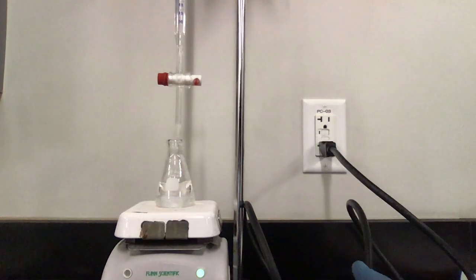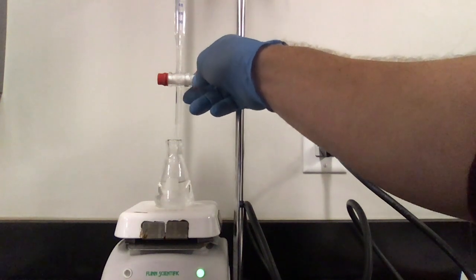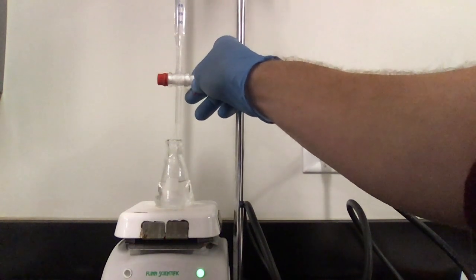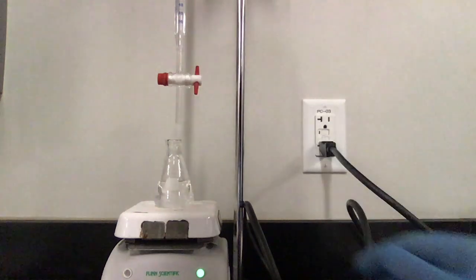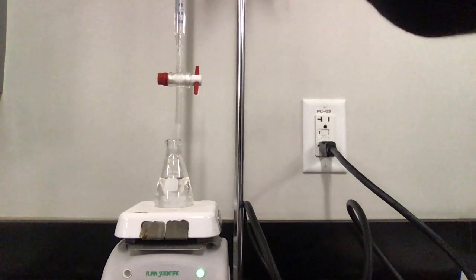Now, when doing a titration, I want to go fairly slowly because I want to know exactly the amount of titrant that I had to add in order to have my reaction. And we'll talk a little bit more about that as we do our post lab. I'm probably going to speed this up for you guys.